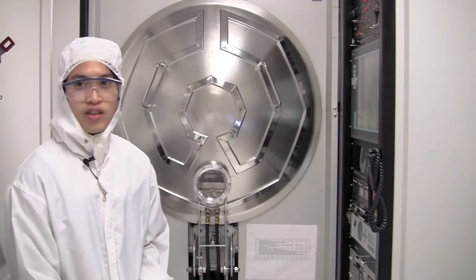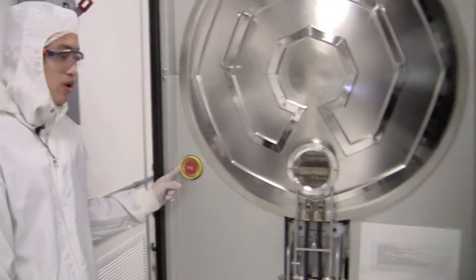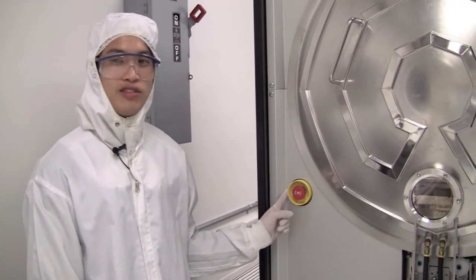If ever the machine goes into an unsafe state we can always hit the emergency off button to safely shut down the tool.